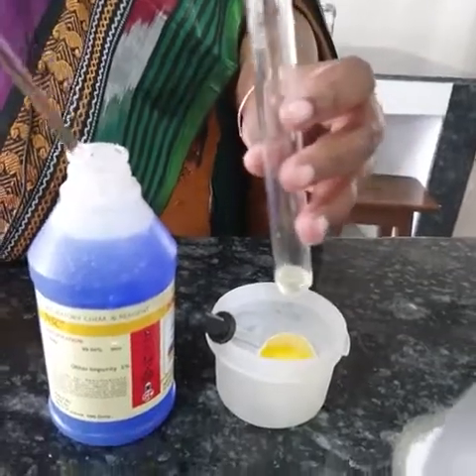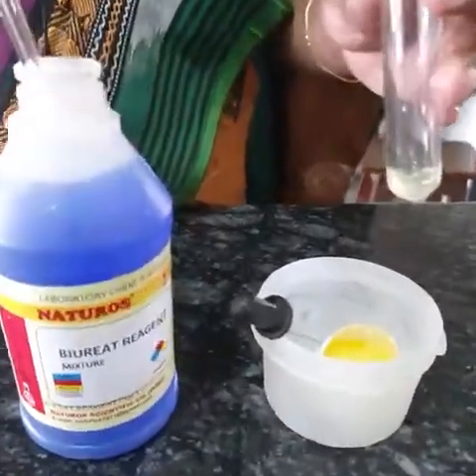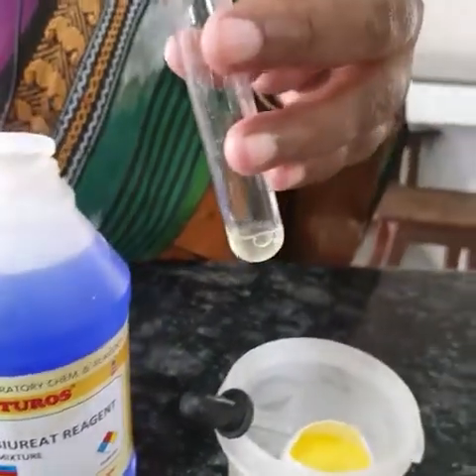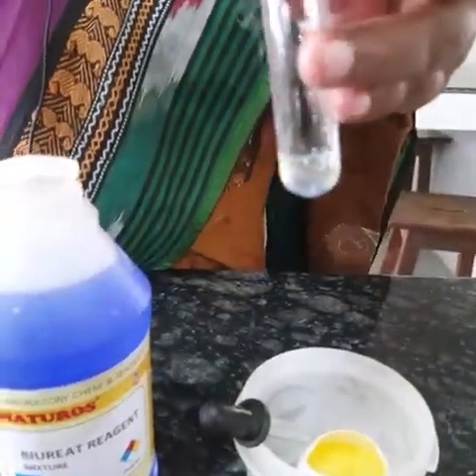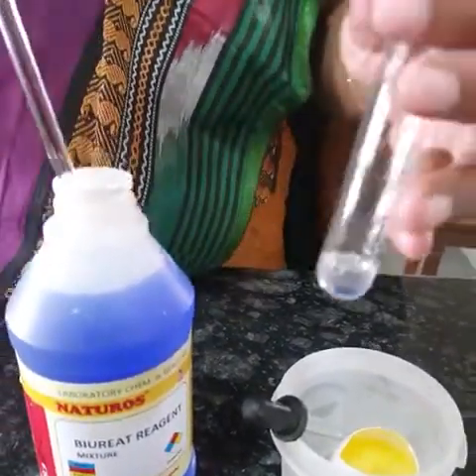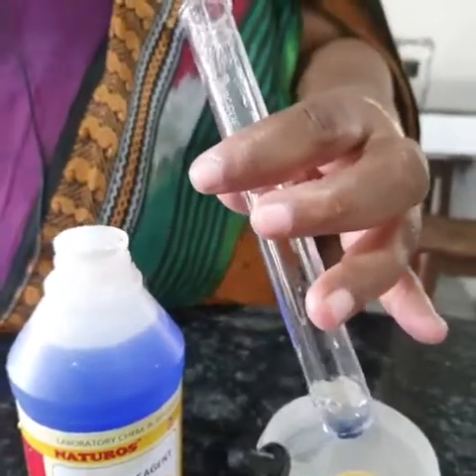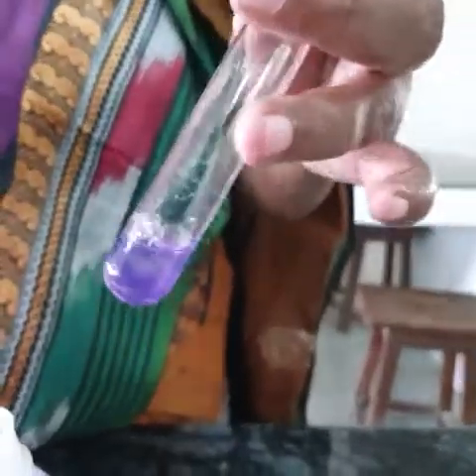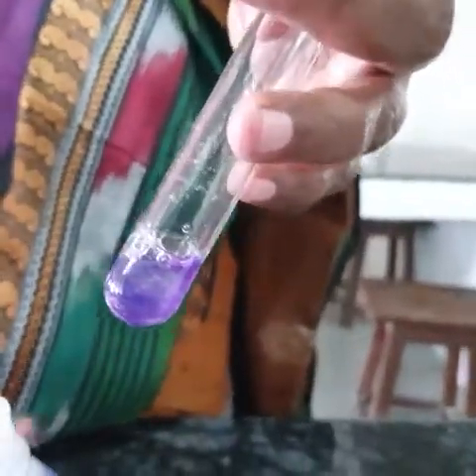When I add the Biuret's reagent, it changes to purple color completely. Observe the color change — this is the result you are supposed to get when you test this reagent with protein.